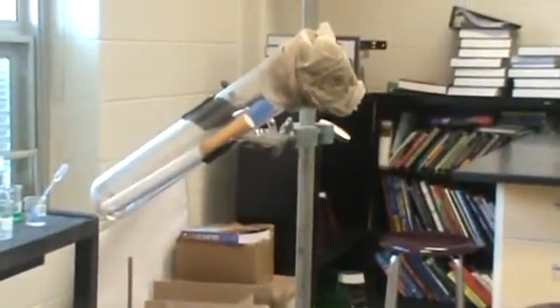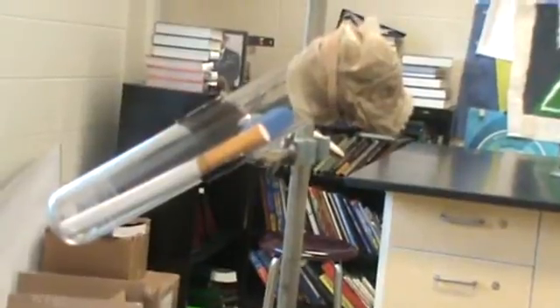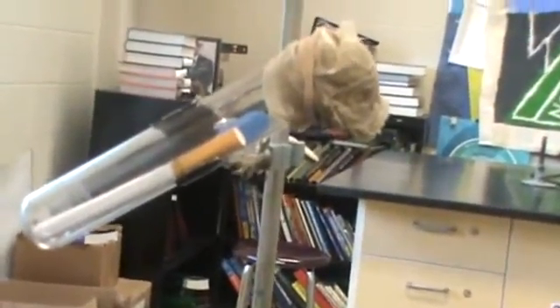I put a cigarette inside of a test tube, and on the cigarette I've put some wet paper towel tied on with a rubber band just so it'll stay in place. That's going to let my pressure not build up, but it's also going to keep most of the stuff contained as I burn the cigarette. I can light that cigarette through the test tube using a Bunsen burner.